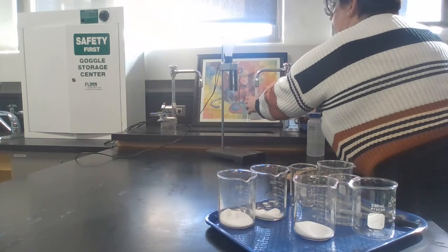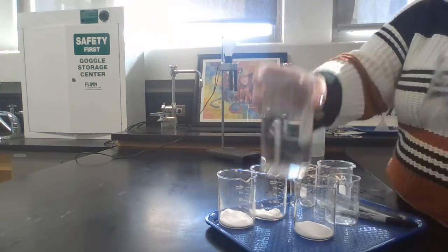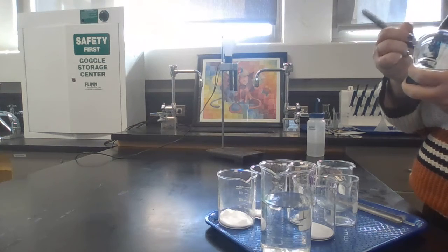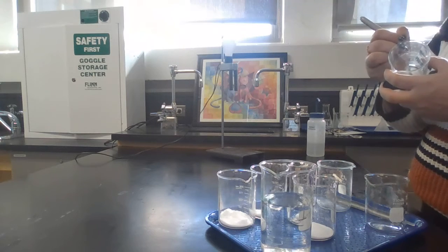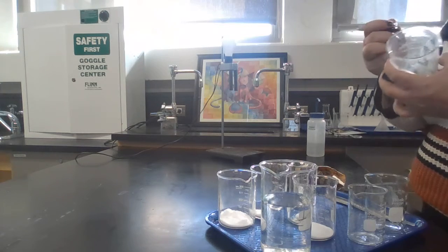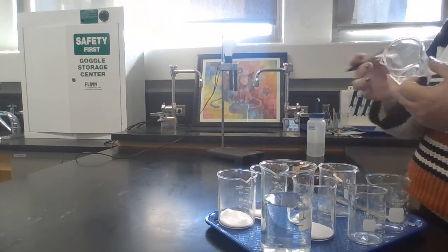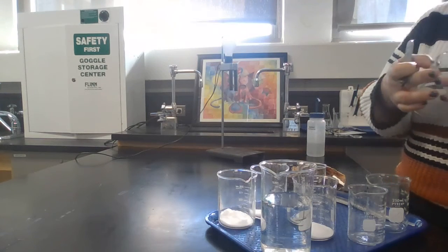So what you'll do is get some distilled water, and take each of your empty beakers, and you can label them with your Sharpie. Okay, so you're going to have one that's NaCl, one that is sugar, I think I give you the formula for it as well, one that's KBr, and one that's just plain water. Okay, so label all of those, and you just write it on the glass part with your Sharpie.